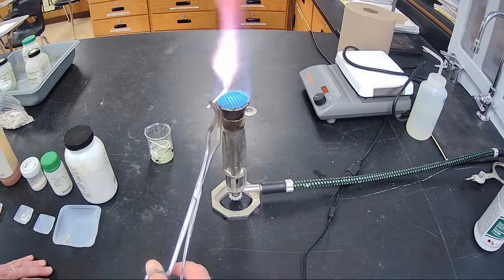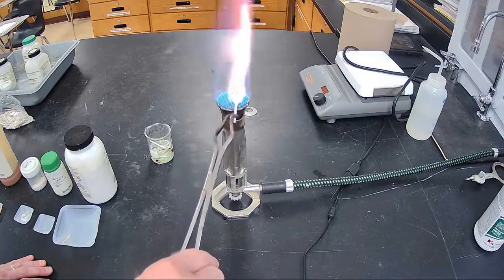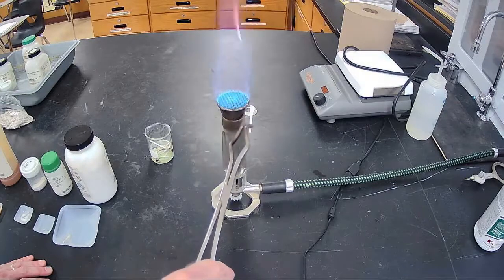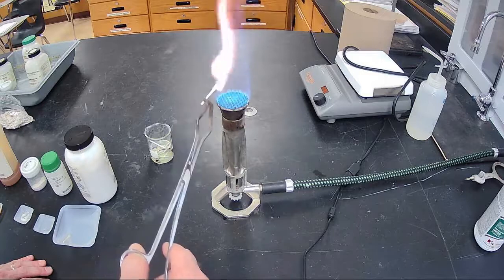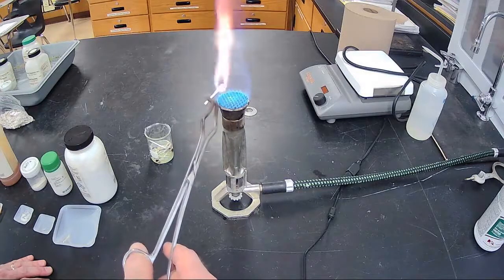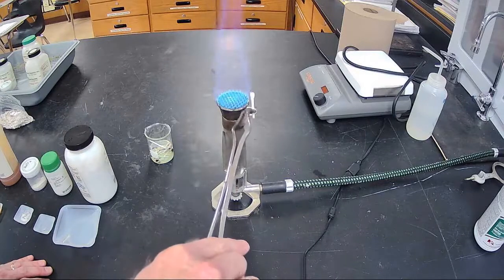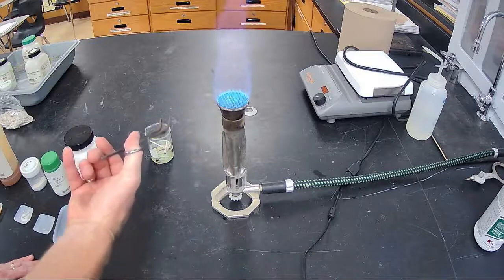Once it gets going, now you can see it really good, a pinky lavender color. More lavender than anything. There you go on the side. Light lavender. Very good, and that's number 8, more of a pinky lavender color, tough one to see.